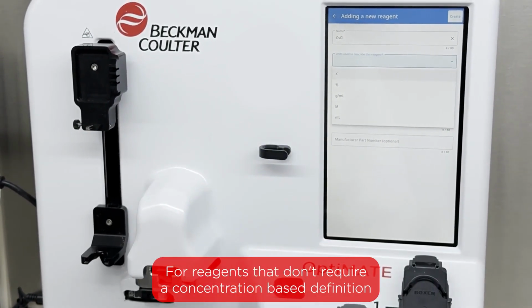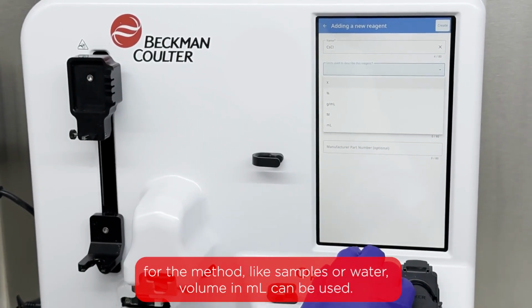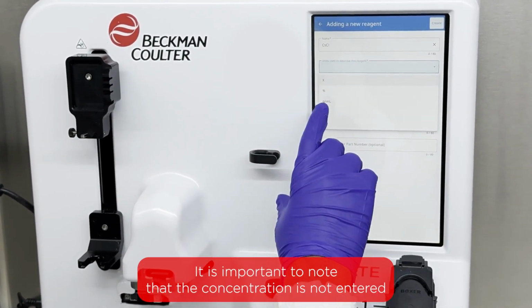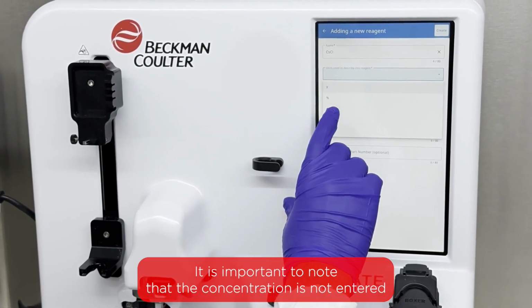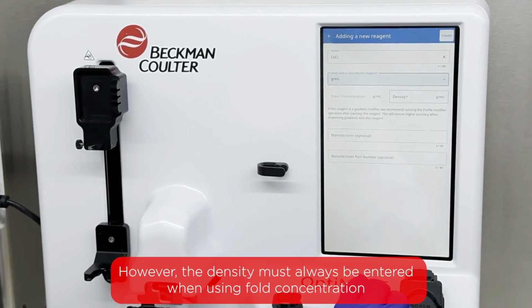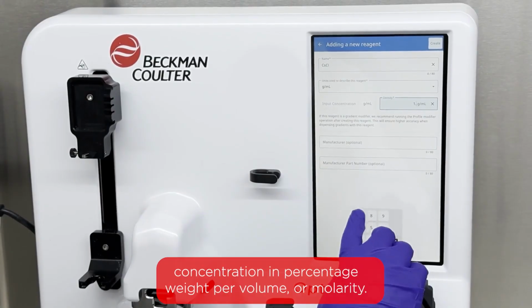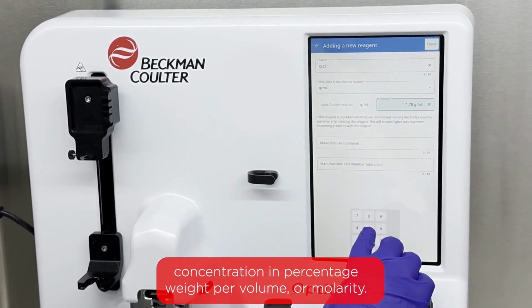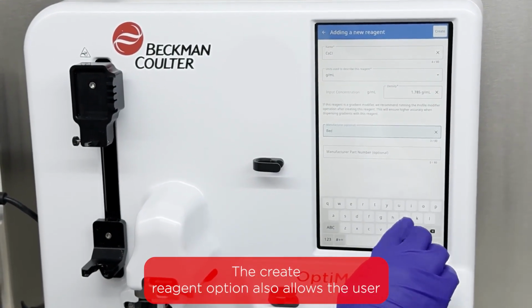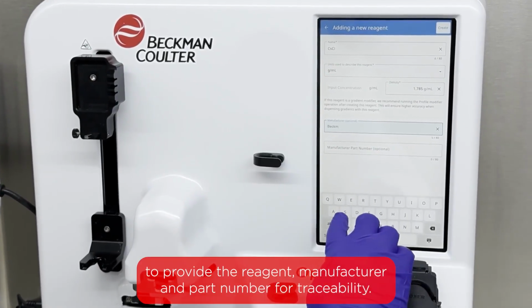For reagents that don't require a concentration-based definition for the method, like sample or water, volume in mL can be used. It is important to note that the concentration is not entered if the reagent unit is volume or density. However, the density must always be entered when using fold concentration, concentration in percentage weight per volume, or molarity. The Create Reagent option also allows the user to provide the reagent manufacturer and part number for traceability.